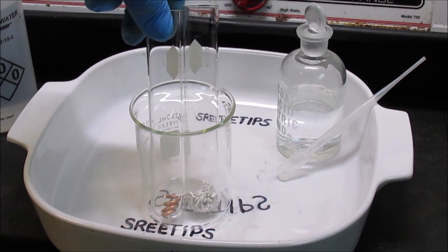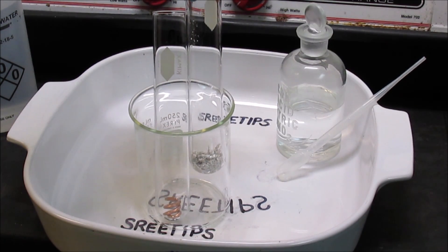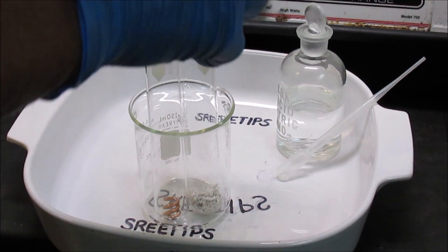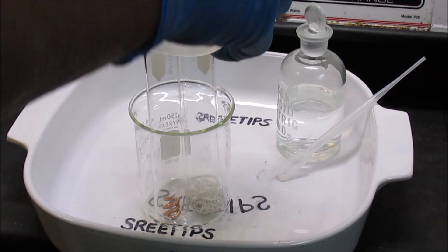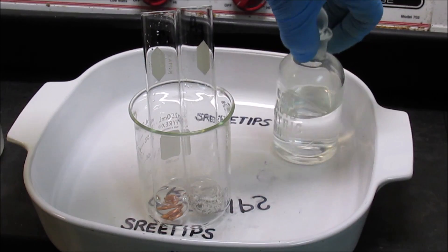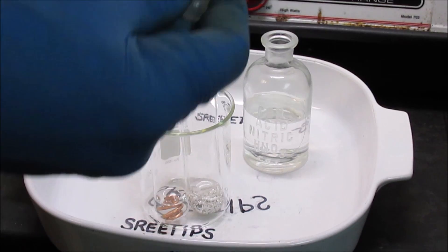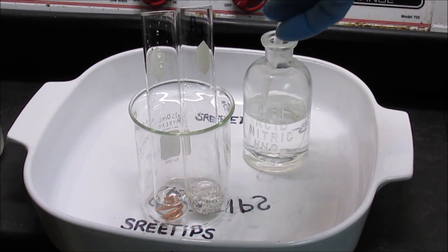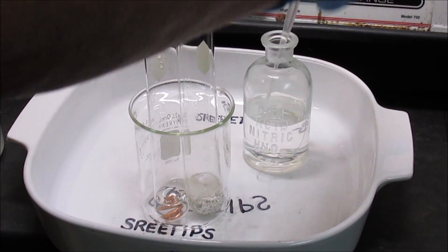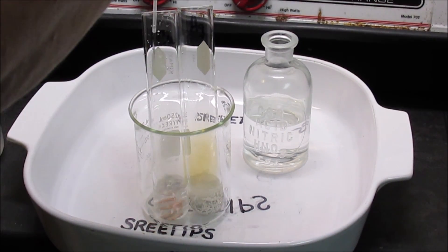What I have here is two tubes. One's got about six grams of copper. The other one's got about the same amount of silver — pure silver crystal. I'm going to add a little distilled water to each of these, and then add a little bit of concentrated nitric acid to see if we can get both of these things to go into solution. We're going to do a couple of experiments to demonstrate how the reactivity series of metals works on these metals.